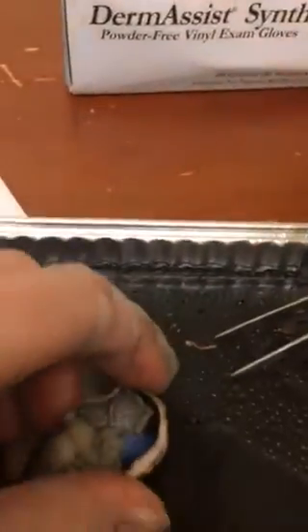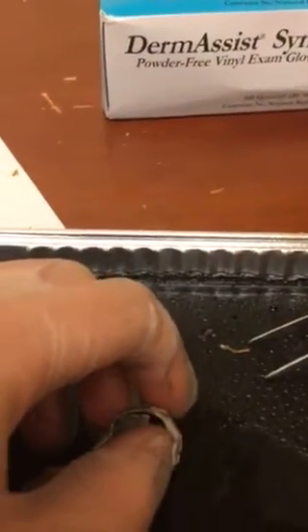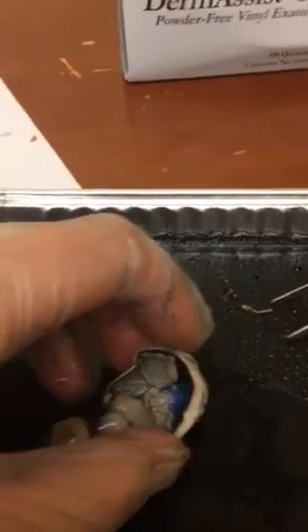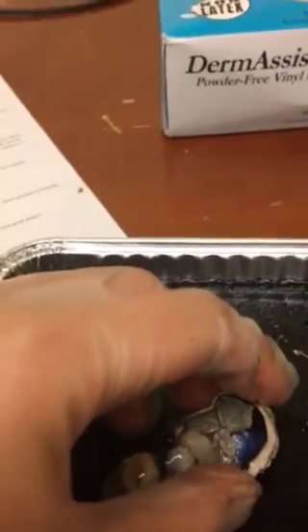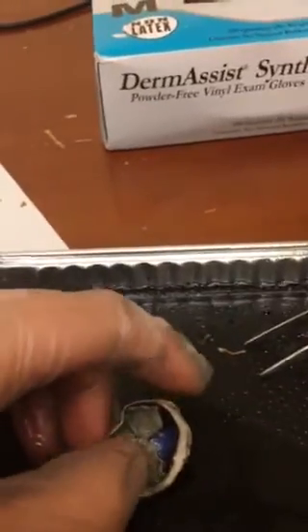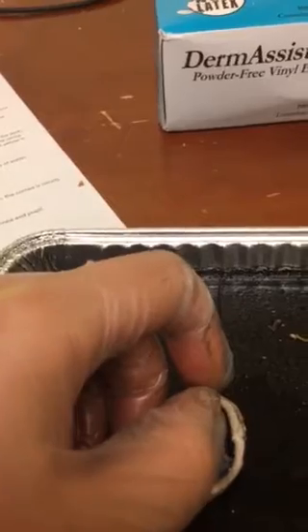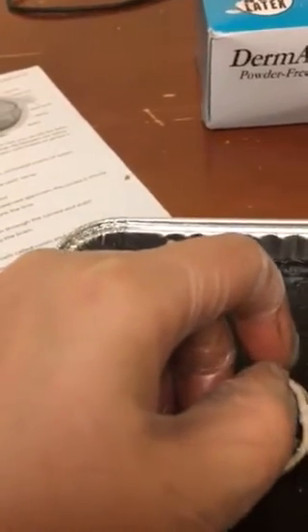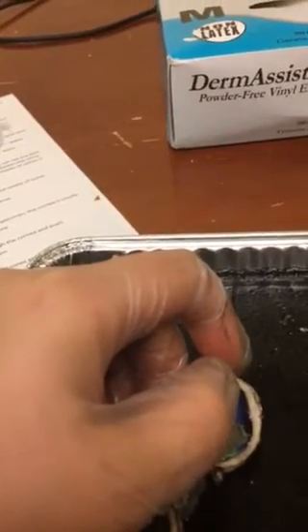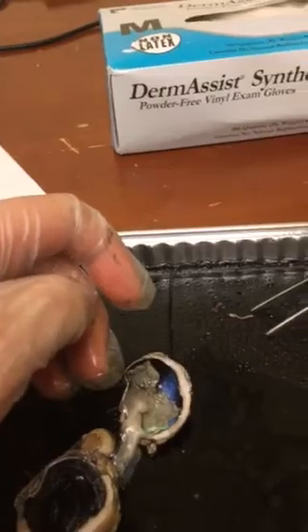And then if we look back here, this thin, dark sheet of tissue between the sclera and the retina is called the choroid. And then this iridescent matter in here is called the tapetum lucidum. It's an iridescent portion of the choroid tissue, and it helps in night vision by reflecting the available light back onto the retina, and that's only found in animals.